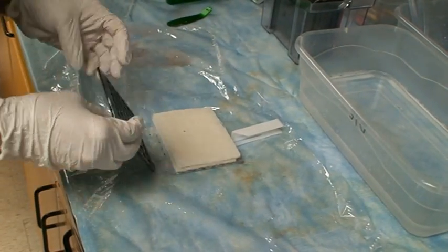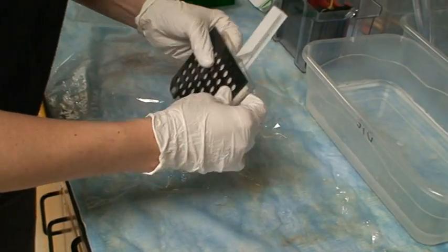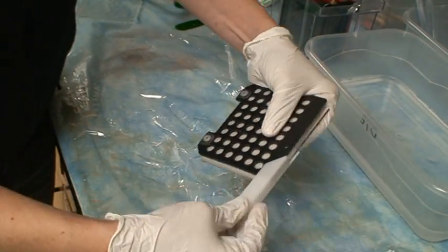And then you'll close the cassette. So fold the black side over, lift the whole thing up and then latch it. And it will be a tight fit.